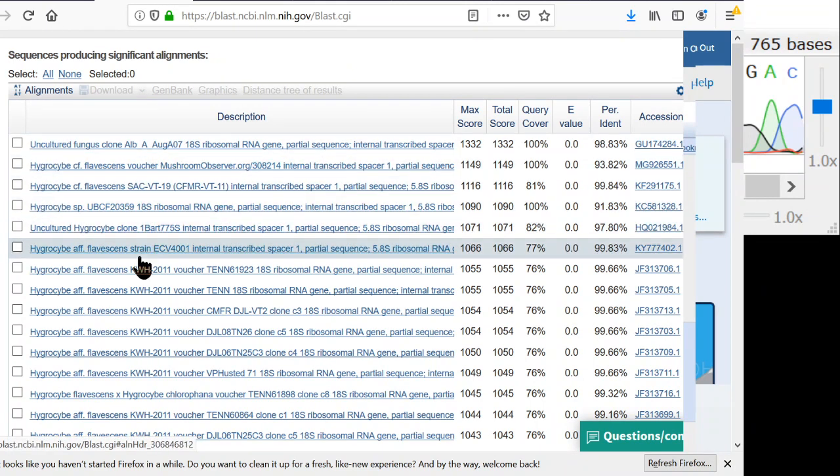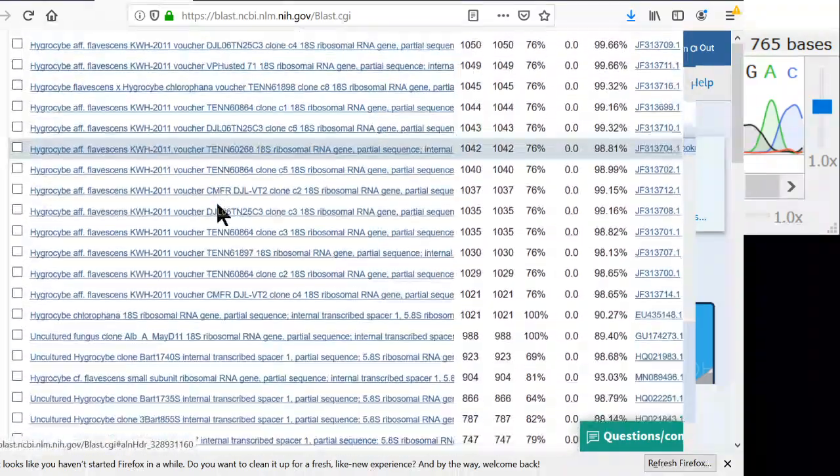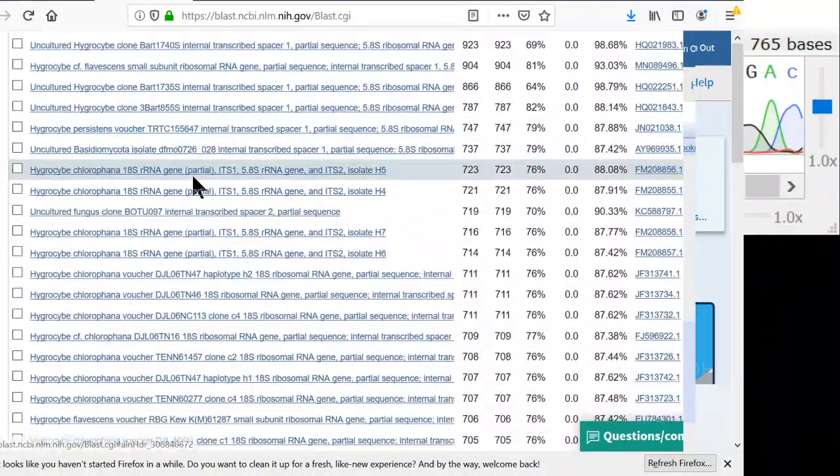Now these names you have to take with a grain of salt, because anyone can upload sequences to GenBank, and anyone can put any name on any sequence they upload. When I upload a sequence to GenBank, I try to put the best name I can on it, but sometimes I learn later that I didn't have the right name on it, so then I'll send an email to GenBank and update the name, sometimes, if I remember. Though most people just submit sequences and kind of forget they're there, so there's a lot of misnamed sequences in GenBank. And so these actually look like they're named pretty well.